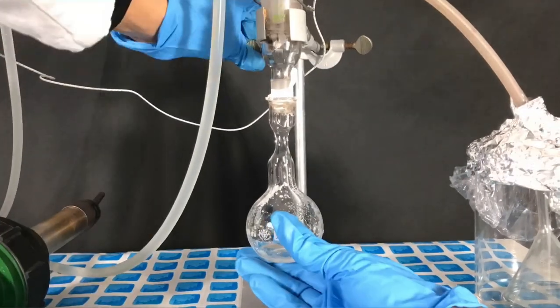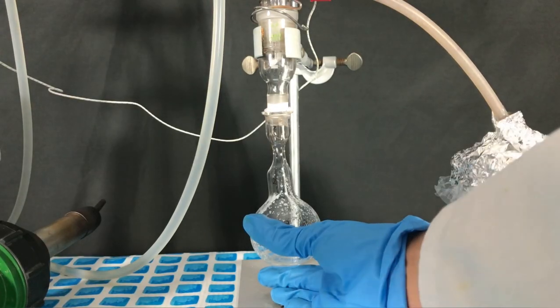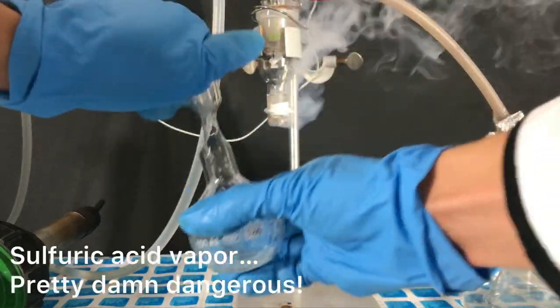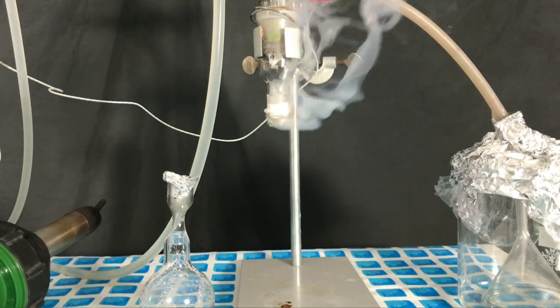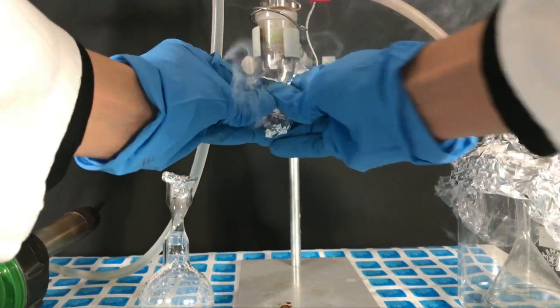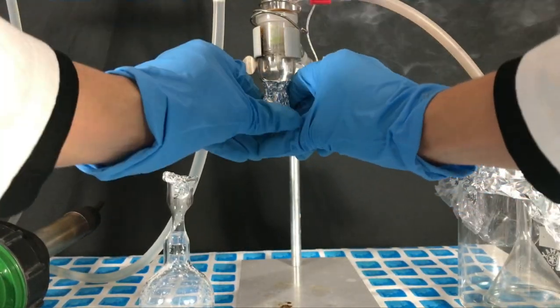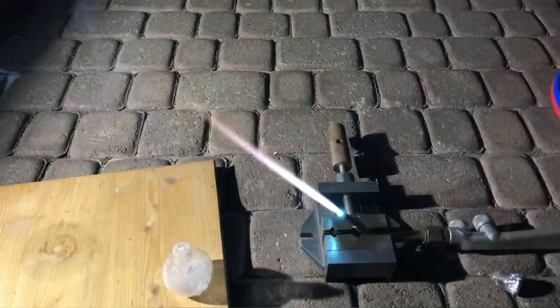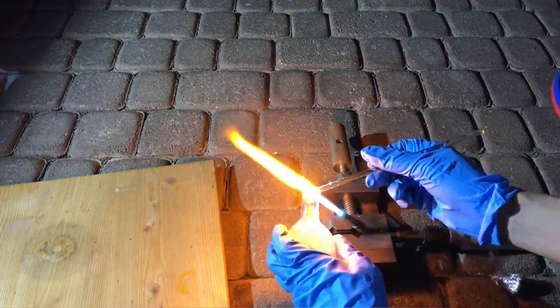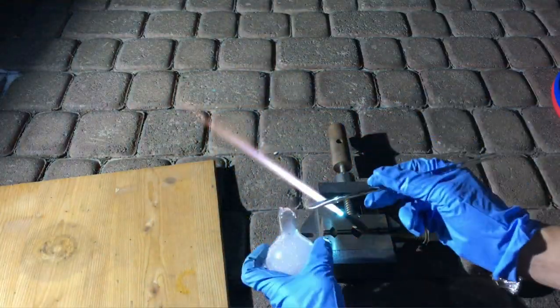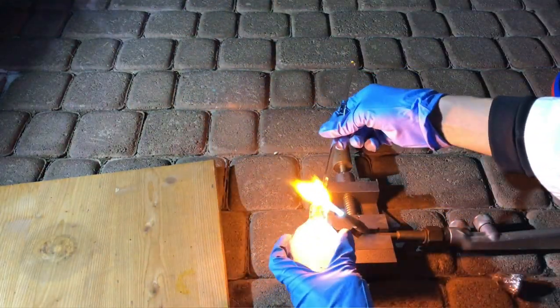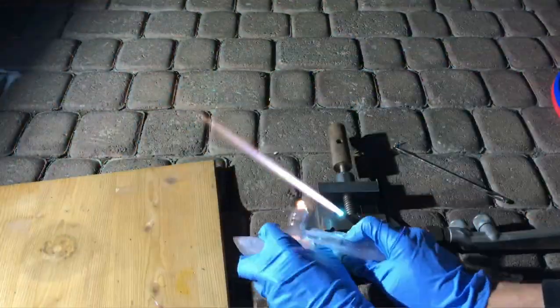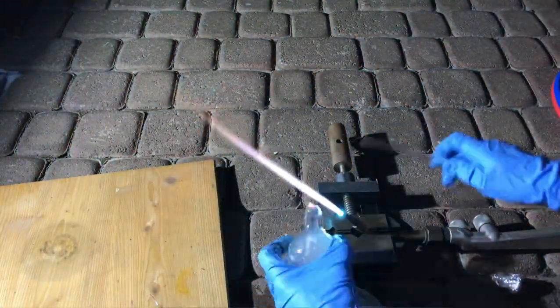Again, the sulfur trioxide in the neck of the ampoule was melted and the ampoule was disconnected. Because no more sulfur trioxide was going over, the whole of the apparatus was plugged with some aluminum foil. Actually, aluminum foil is pretty resistant to sulfur trioxide in the short term. We tried to seal the ampoule but we sadly fucked up. There was a hole blown into the ampoule and I tried to fix it using a glass strut and stretching out the glass but it didn't work. The hole either started to get bigger or new holes started to appear. Obviously, sulfur trioxide cannot be stored this way with a damaged ampoule.